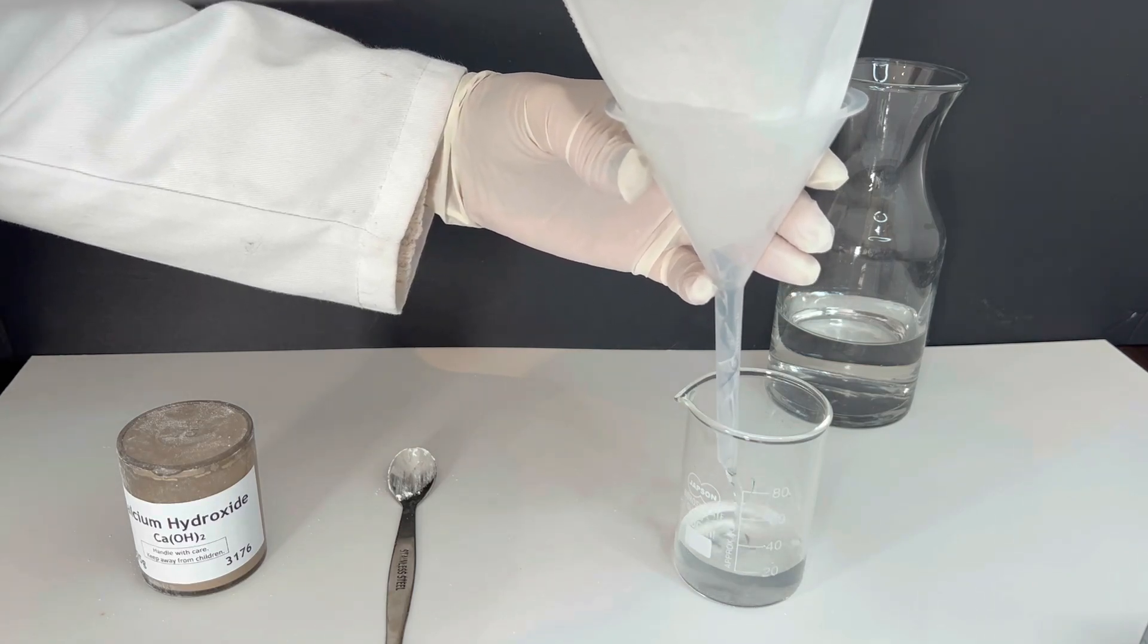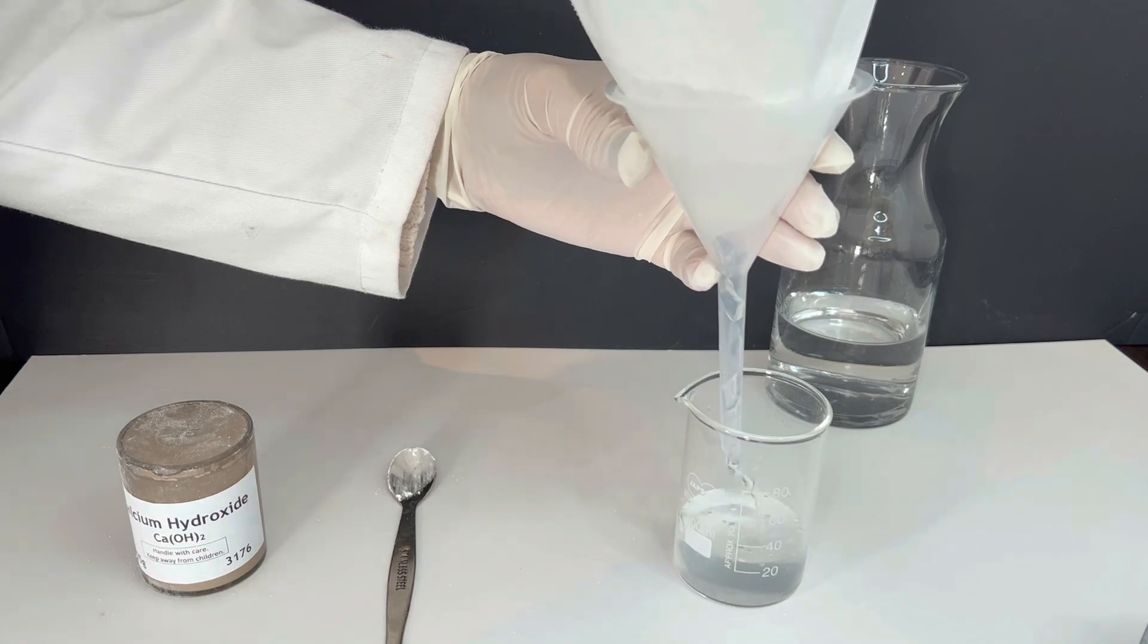The filtered liquid is your lime water. It should be clear and colorless.